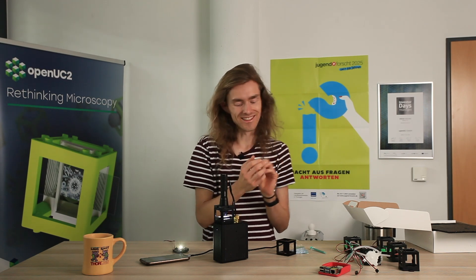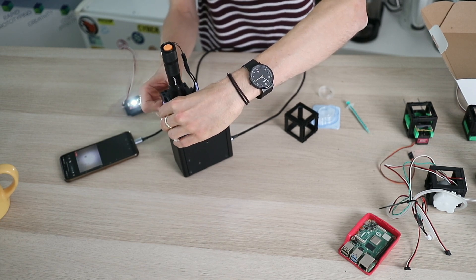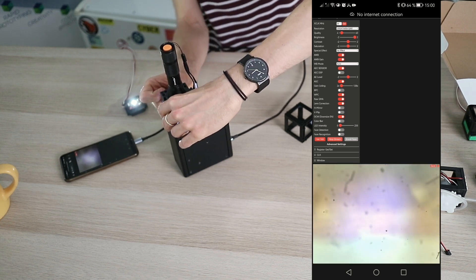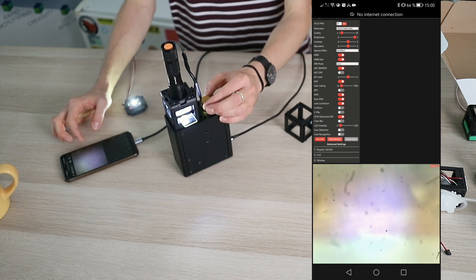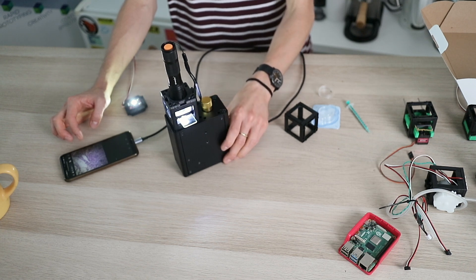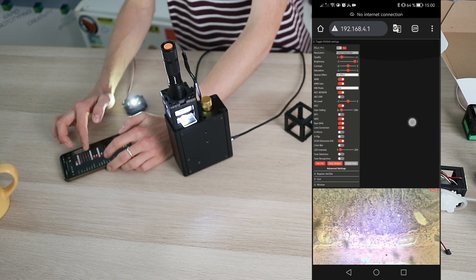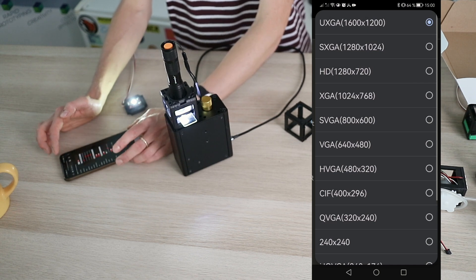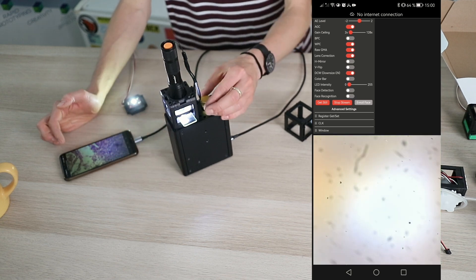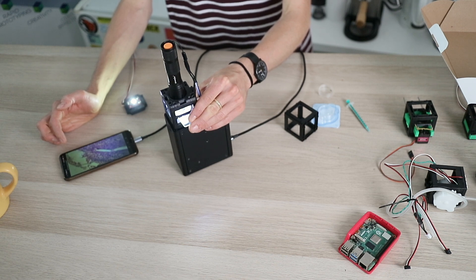The image is then slightly overexposed, and of course we need a sample for this. We have an intestine sample from a microscopy slide collection. You put that here on the magnetic slide holder so that it will stay firmly on the microscope, then search for the spot where the sample is. You can use the micrometer screw here to place the 10x objective lens with an NA of roughly 0.25. You can change from low resolution to the maximum resolution which is 1600 by 1200, and then you see the histological slide scan which is an H&E staining, so you can move around and observe different components of the cell.